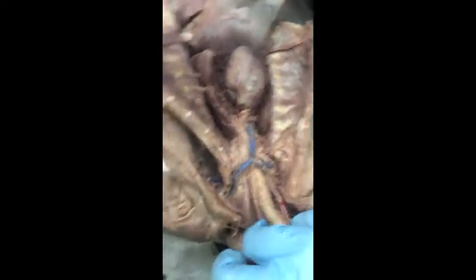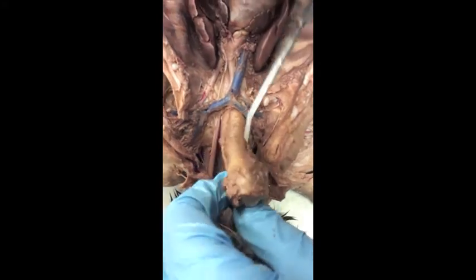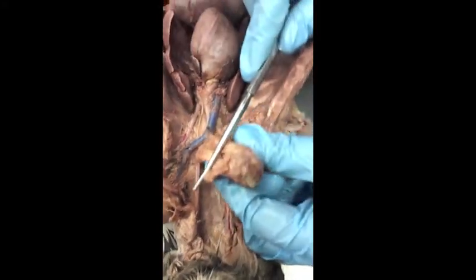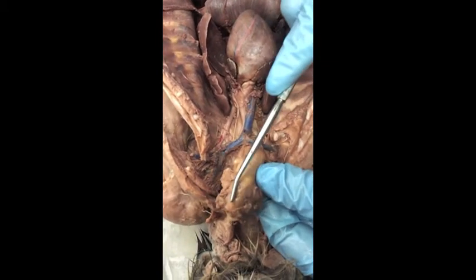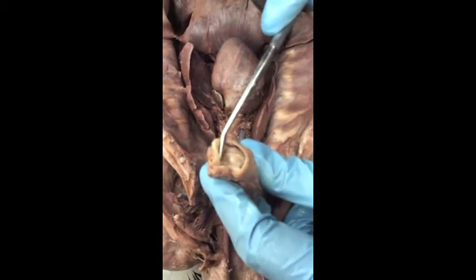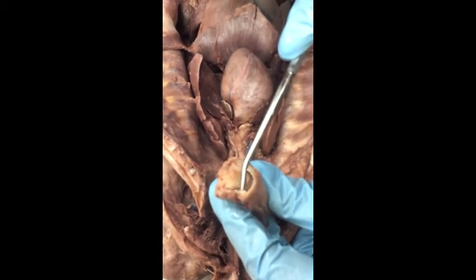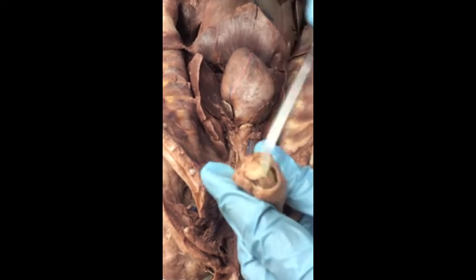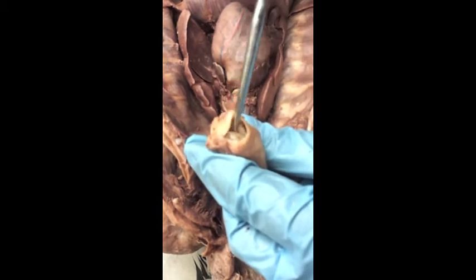Okay, so here we have our trachea. There's a nice hole in it. And at the top end of the trachea, it's still kind of covered in tissue, but this big lumpy thing up here is the larynx, which we have cut so that we can see the epiglottis. So this is the flap that's going to close and cover the airway. If you lift that up, you can see the little kitty vocal folds in there.